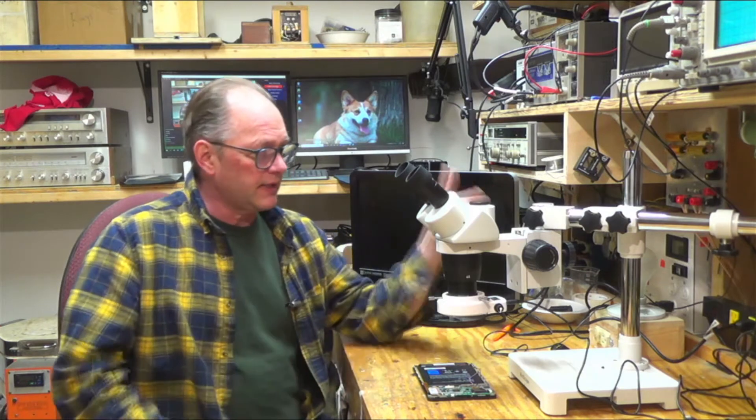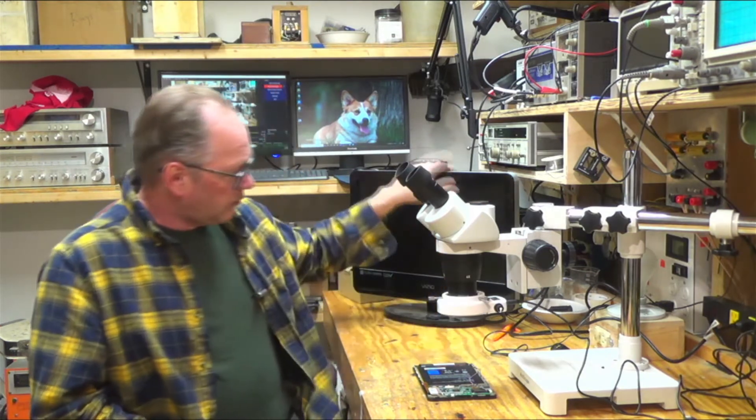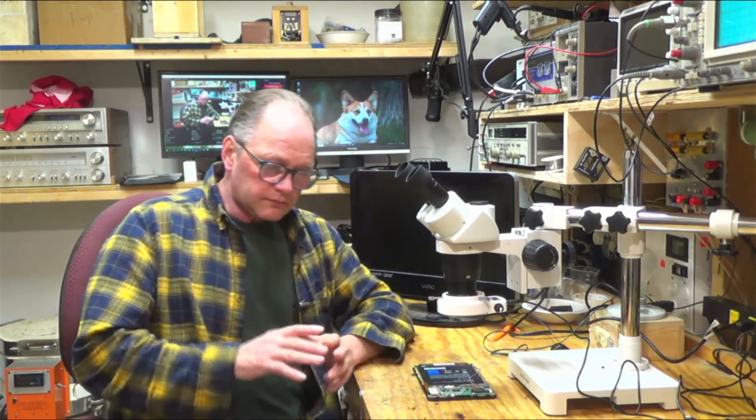And all they had—they had cameras that they provided, but those cameras all needed software that ran on your computer, and I don't want that. I want a camera that can output HDMI and then I can bring it into my—I've started using OBS Studio for doing videos.